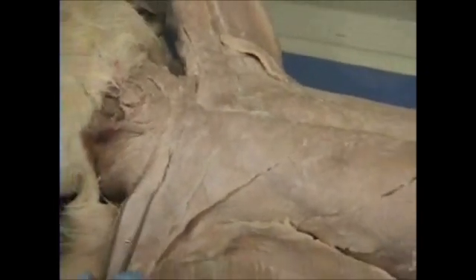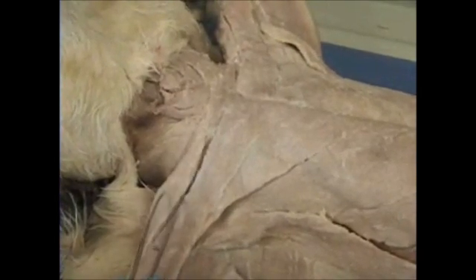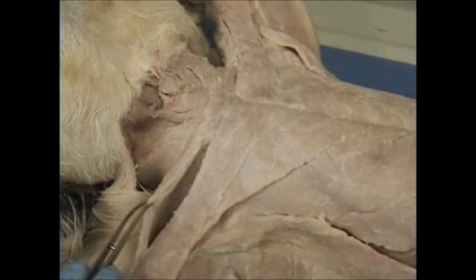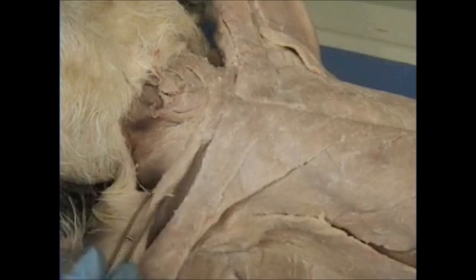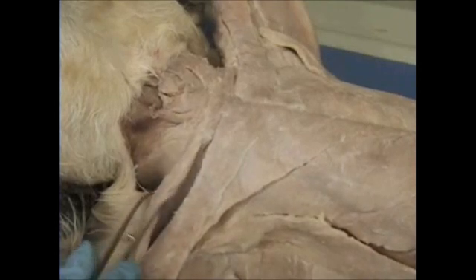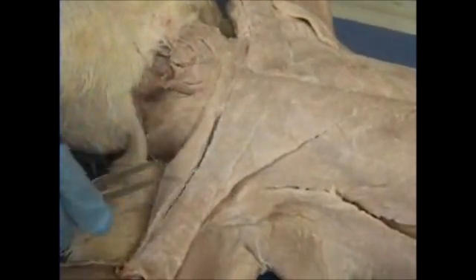Continuing down to the muscles of the chest area, on the right ventral side, we have our shoulder muscle. Remember, in the human, our shoulder muscle is called our deltoid. And in the cat, we have three divisions, three different names. But the one we're looking at right now covers our clavicle. So this is called our clavodeltoid muscle. Clavodeltoid. The division of your clavodeltoid goes all along here.